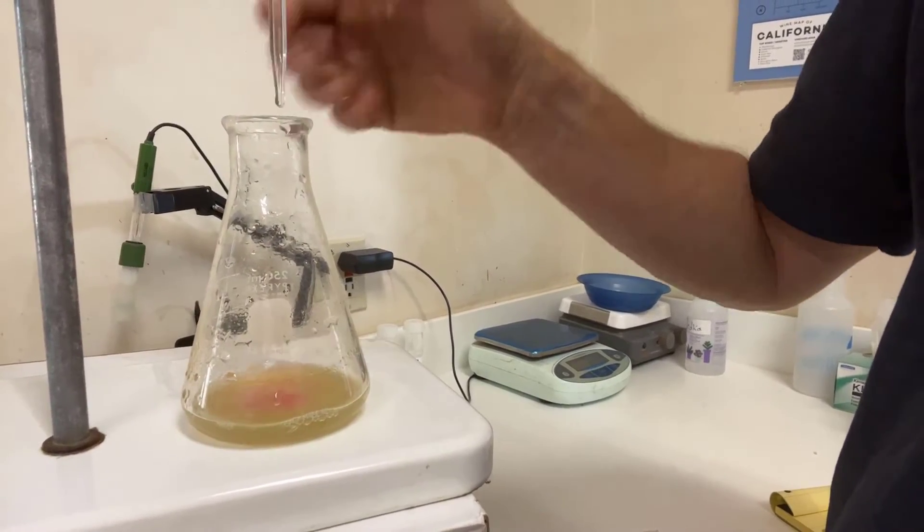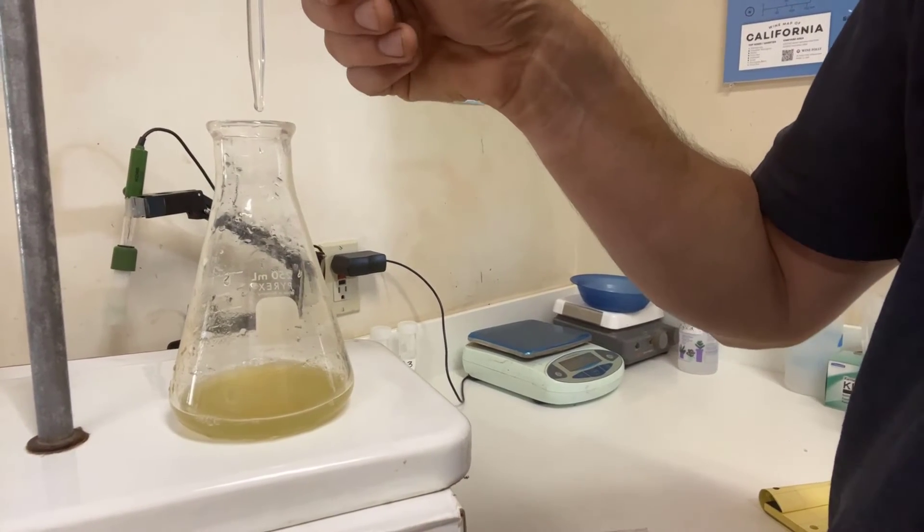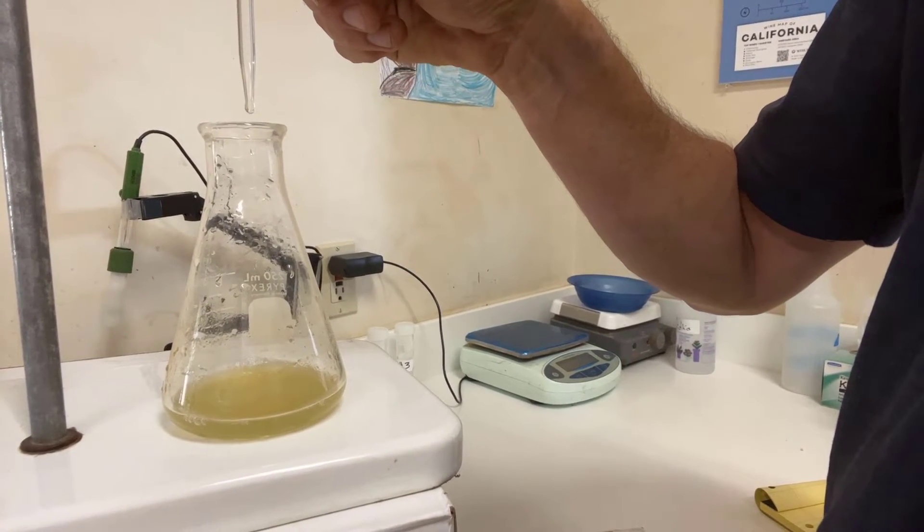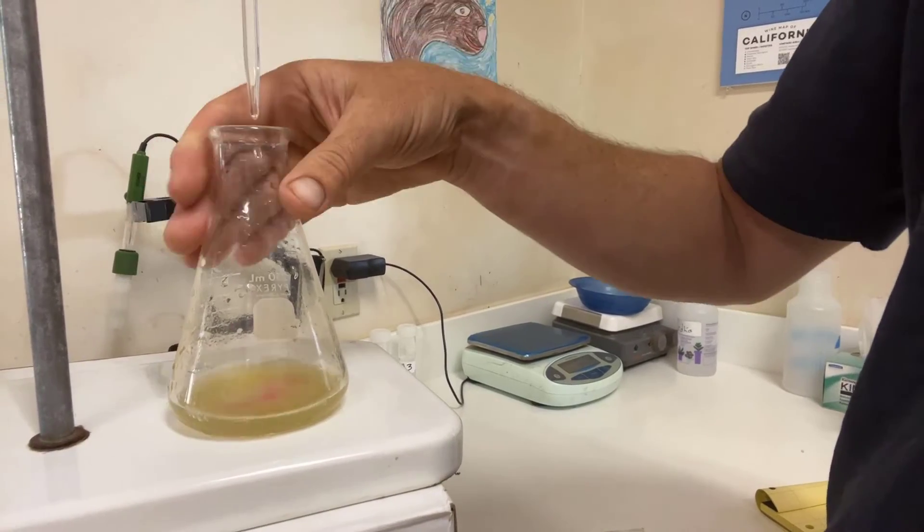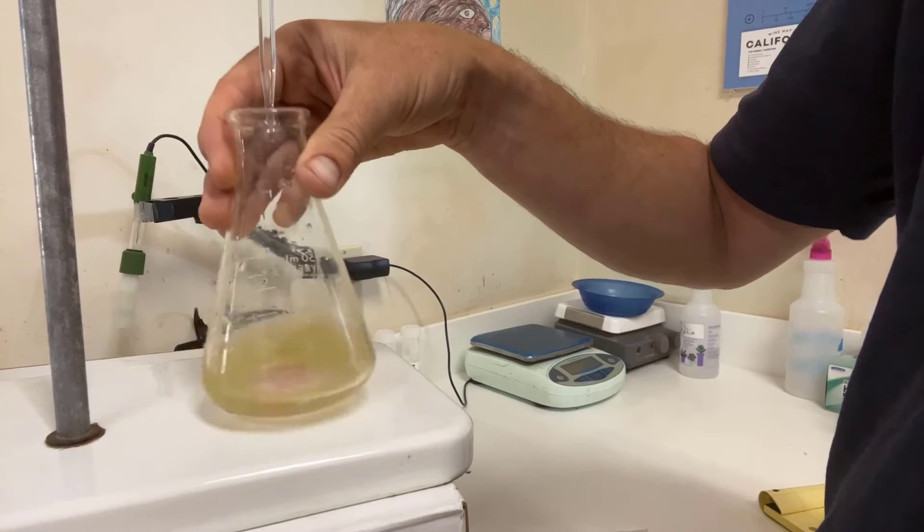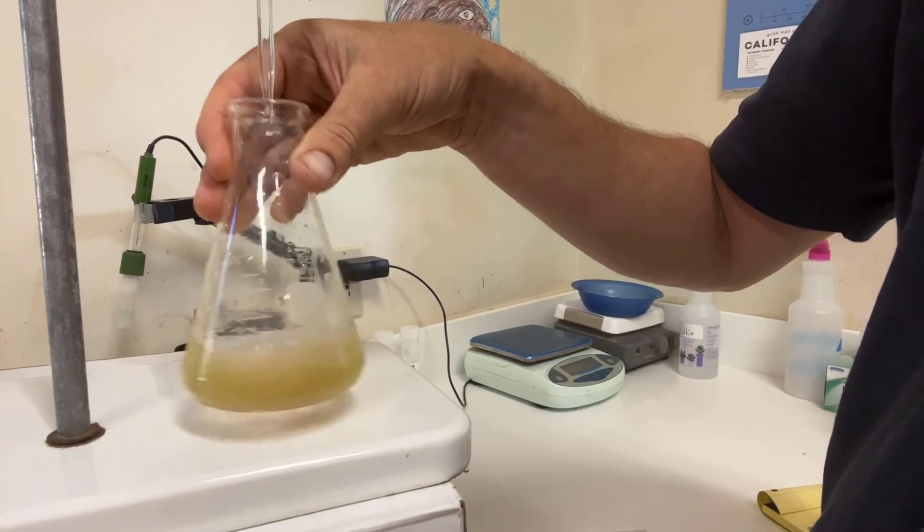Right now you can see if I turn off this, the pink goes away. That's the base being consumed. So we're going to continue this, maybe go a little bit slower until this all turns and remains pink. The pink persists longer and longer as we get closer.